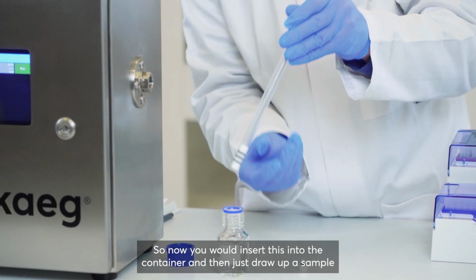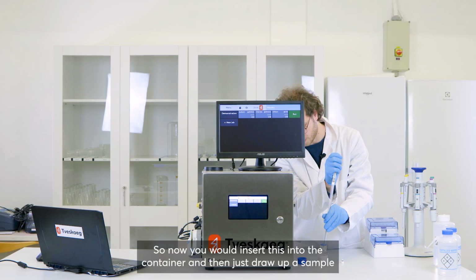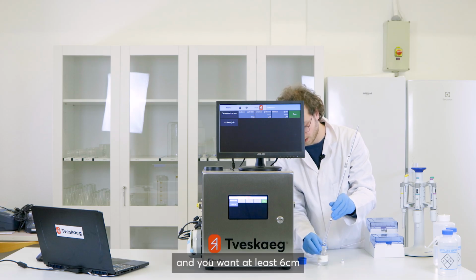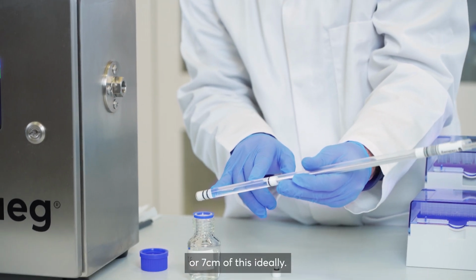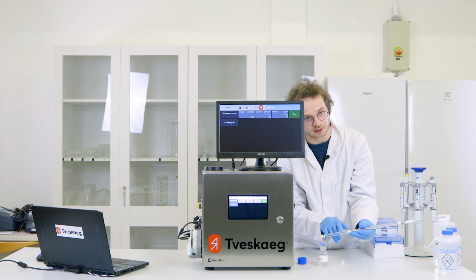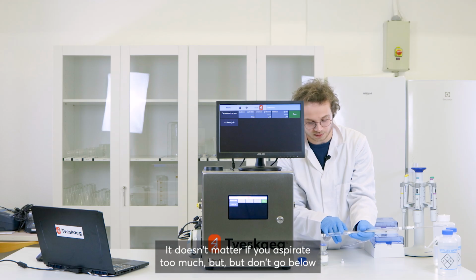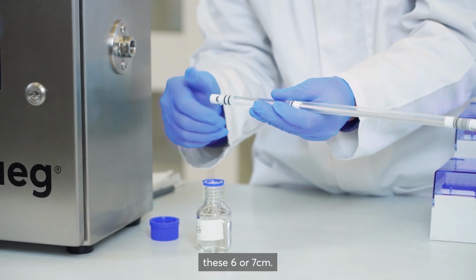So now you would insert this into the container and then just draw up a sample. You want at least 6 or 7 centimeters of this, ideally, which is about 3 inches in imperial units, to be aspirated. It doesn't matter if you aspirate too much, but don't go below these 6 or 7 centimeters.